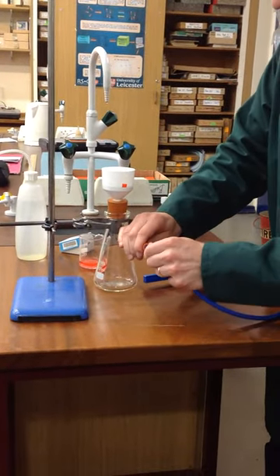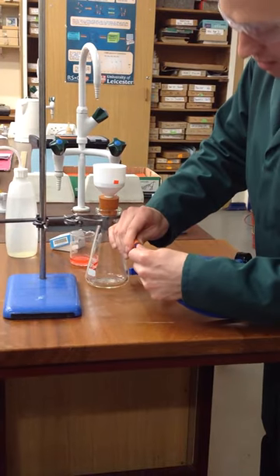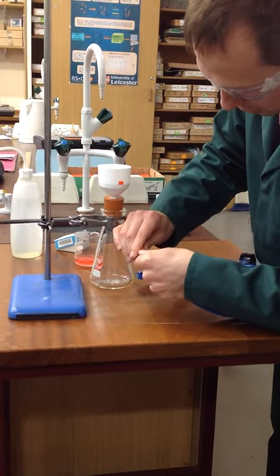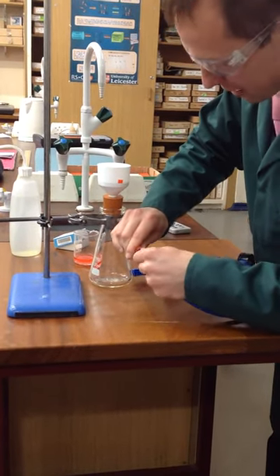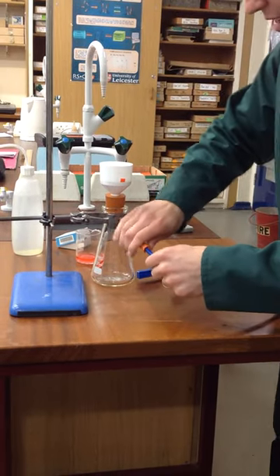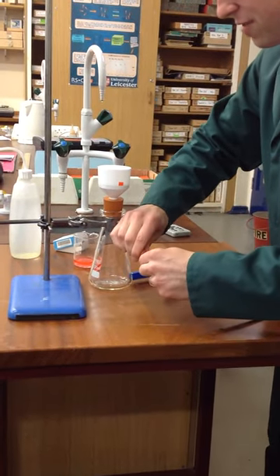Now if I connect up this device here, you basically just want to connect that inside the tubing here. It's a little bit fiddly. Now if you can possibly use a blue one, I think they're better, but there are silver ones that are a bit heavier.